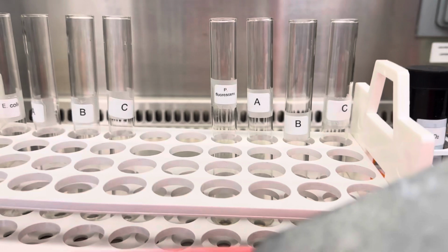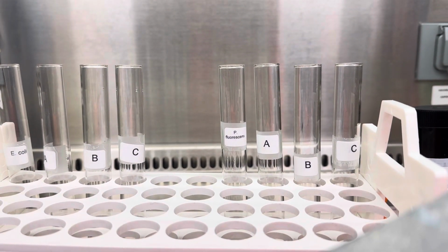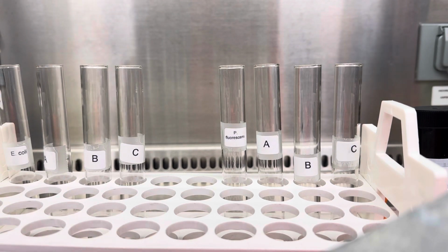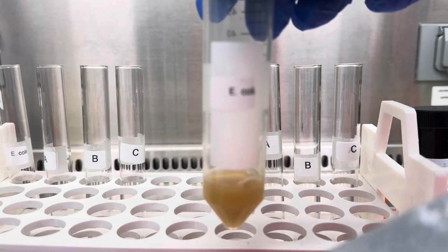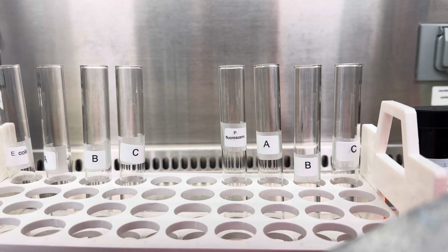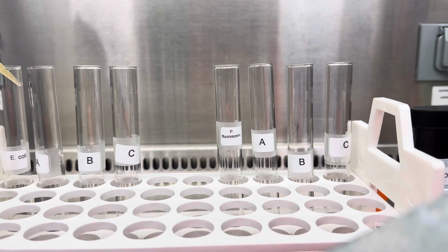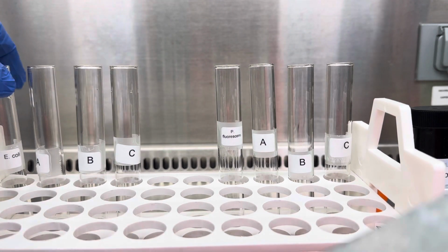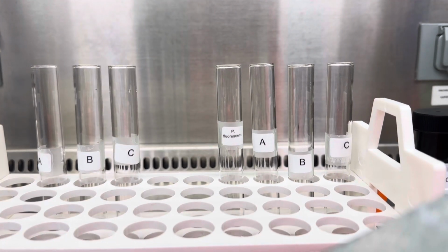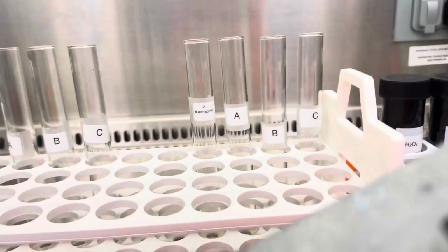So I'm going to place my phone in front of me. We're going to start with a catalase experiment. So we're going to use the positive control, which is E. coli. So here I have the tube of E. coli so you can actually see. Okay, I'm going to take 0.5 ml of that, and then I'm going to place it into the tube here in the corner. Then we're going to quickly vortex it because it says vortex for a few seconds. My apologies for the sound of this vortexing right here.